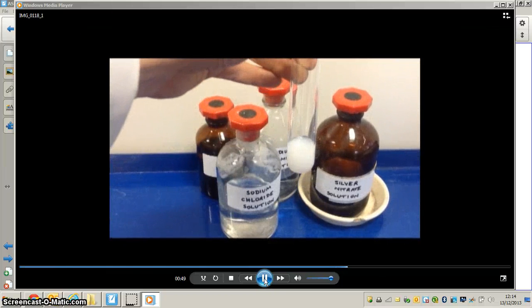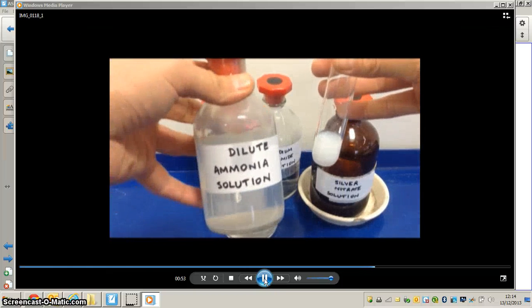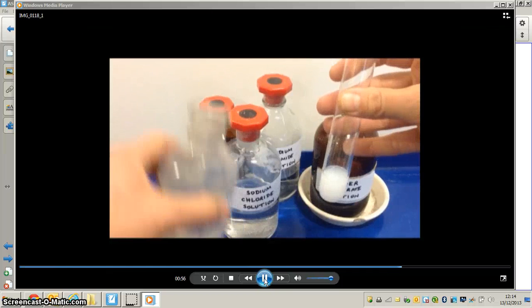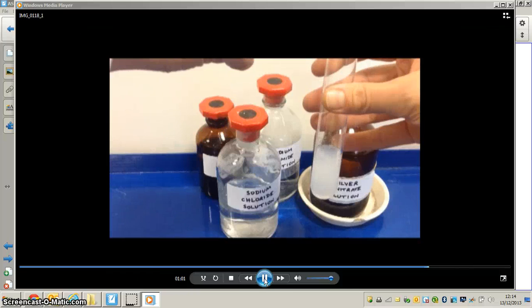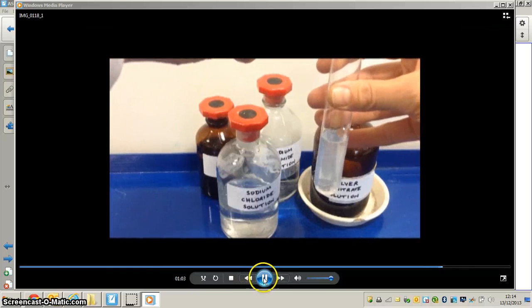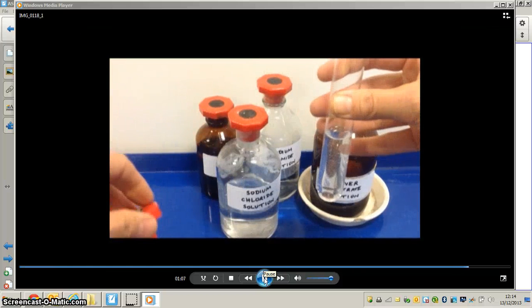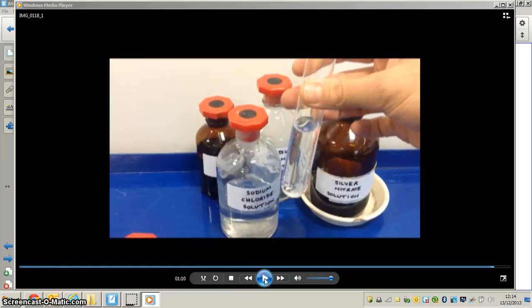Now what we can do is add some dilute ammonia. What will happen when we add dilute ammonia is that the precipitate will dissolve, so the solution will become colourless. But what is the difference between this and a bromide?